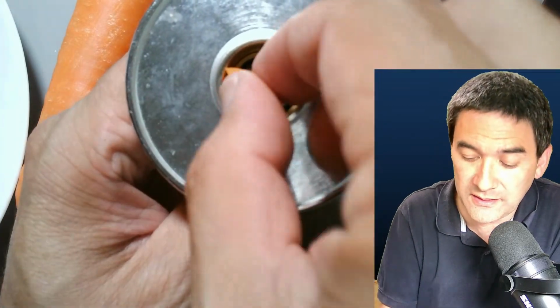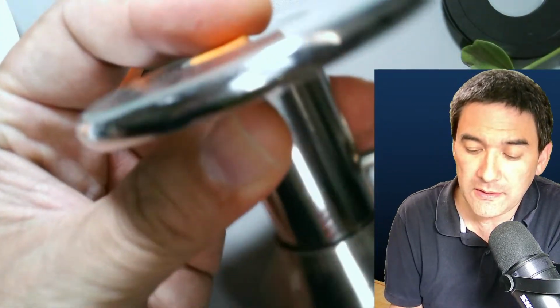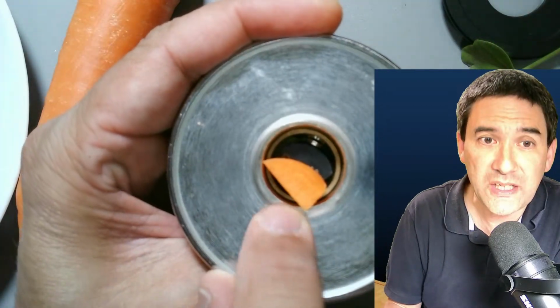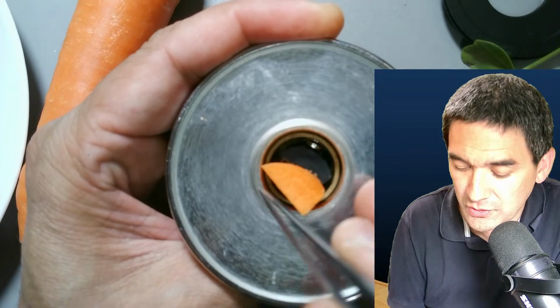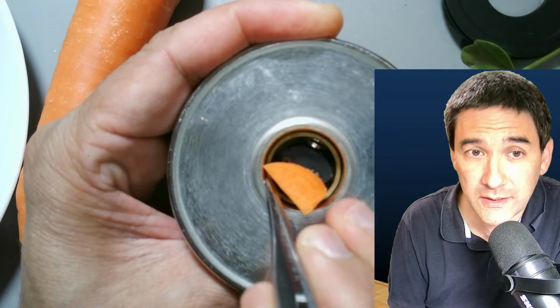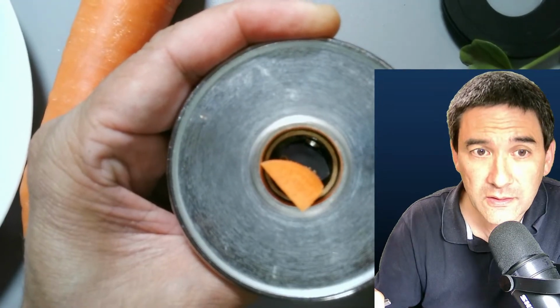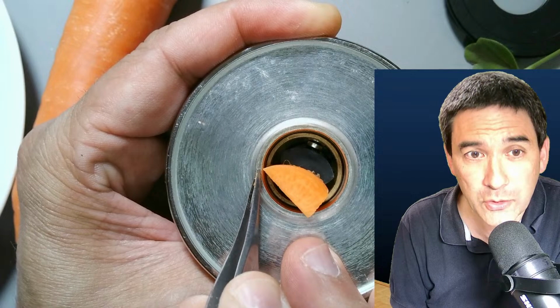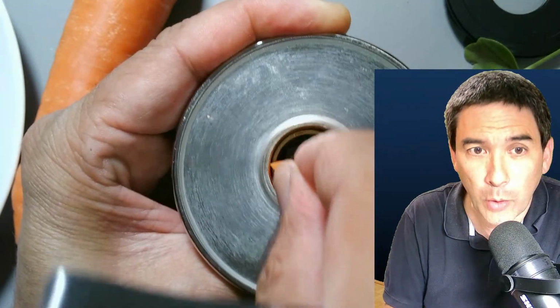Now even though it's held in place, that's the nice thing, but if you advance it out a little bit, you see that essentially, because it does not touch the edge here on the top, there is a little bit, let me use the tweezers here, a little bit of a space here, right? And I'm not talking about this big space over here. Okay, now it's in focus. I'm actually talking about this tiny space here between the glass. This basically means it's a little bit wobbly.